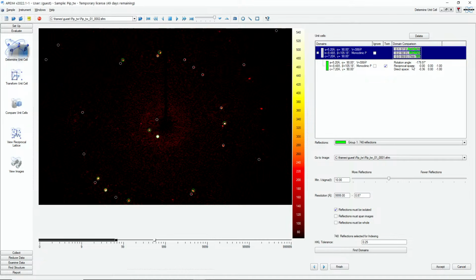Let me move this to the side. And you see here the twin law. They're related by a 180 degree rotation, and then there's also a rotation vector. In this case, it's a reciprocal vector, 0, 0, 1.